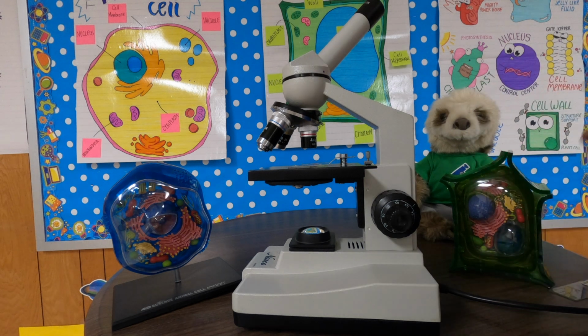Wanted to introduce the microscope to you guys. Dr. Jason Sylvan also uses a microscope, so he's going to talk a little bit about his microscope, and then I will show you the one that we use.